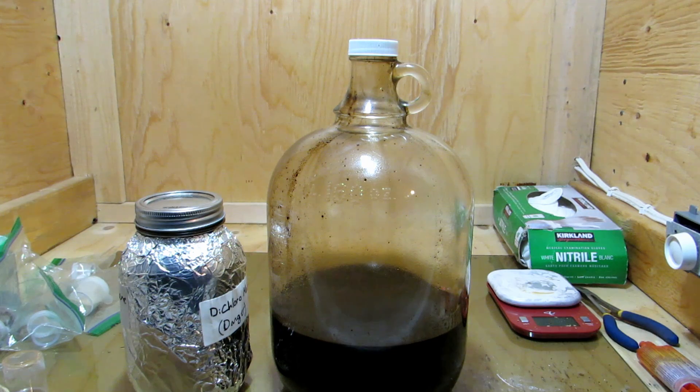The reason why we added the sodium carbonate is there's other things in coffee which will react with the sodium carbonate, forming water-soluble salts. This will help more caffeine dissolve out of those coffee granules. And because the other compounds which react with the sodium carbonate are more soluble, they're less likely to go into the dichloromethane layer and stay in the water layer. Our caffeine is going to go into the dichloromethane layer because it's more soluble in dichloromethane than in water.